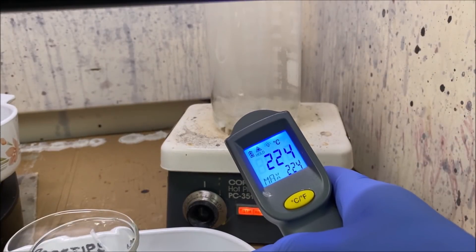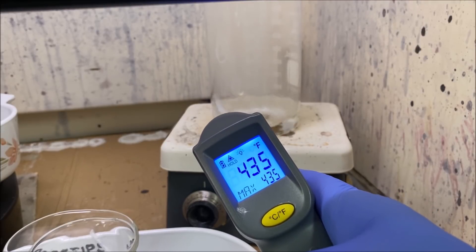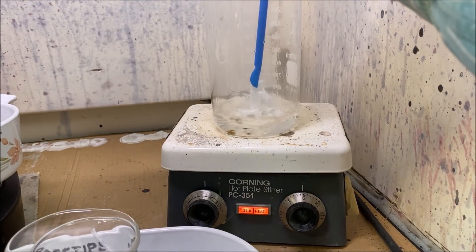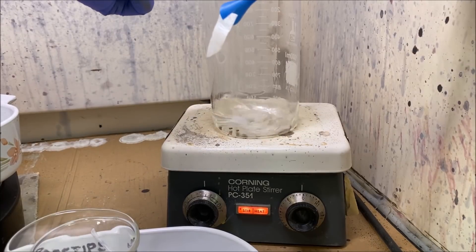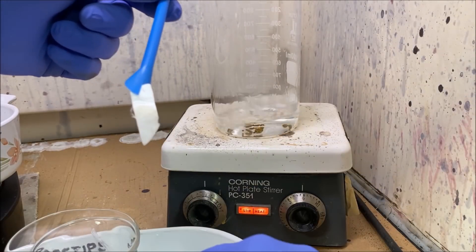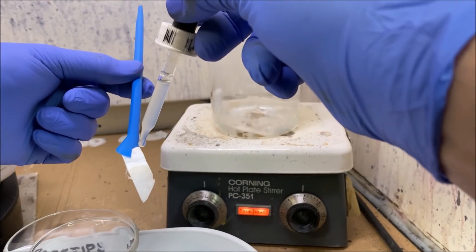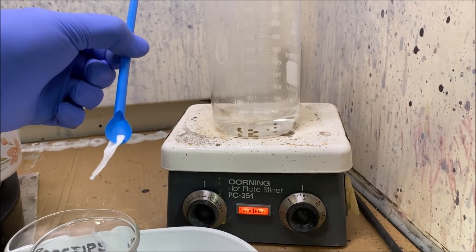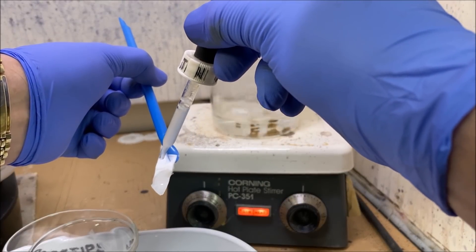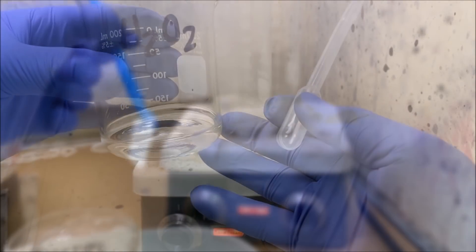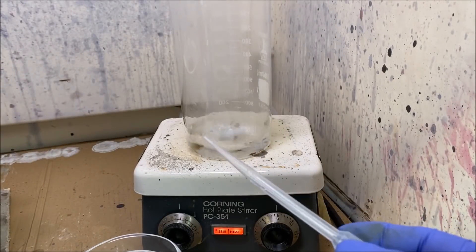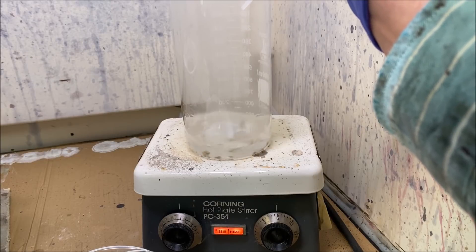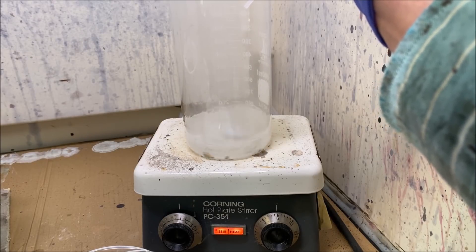Here you can see I've got the heat up to 224 Celsius, 435 Fahrenheit. And now I'm gonna stick a little piece of that fiberglass filter paper down in there and get a little sample on there and we're going to test this with stannous chloride testing solution. And as you can see, the result is nil, and that is baffling to me because it looks like some of the gold has gone into solution. I'm gonna have to figure out a way to detect that gold in that solution. I've got about half of the 50 milliliter charge of 29 percent hydrogen peroxide added into the reaction now. I'll just keep adding it until we get some kind of result from this reaction.